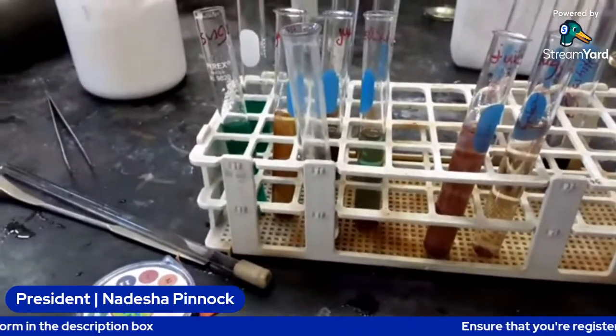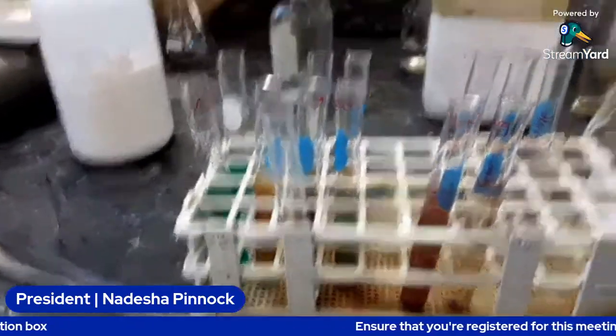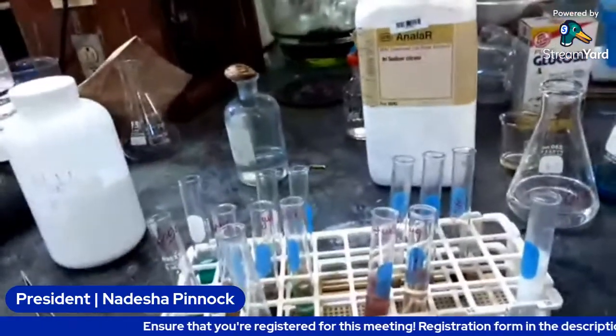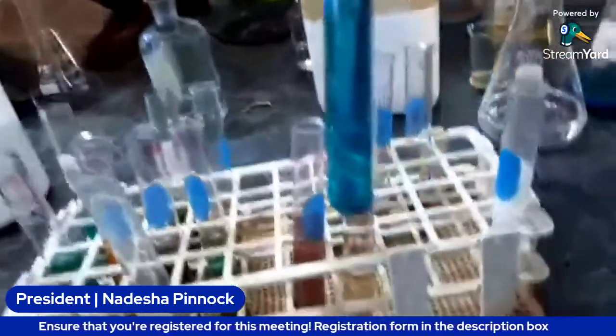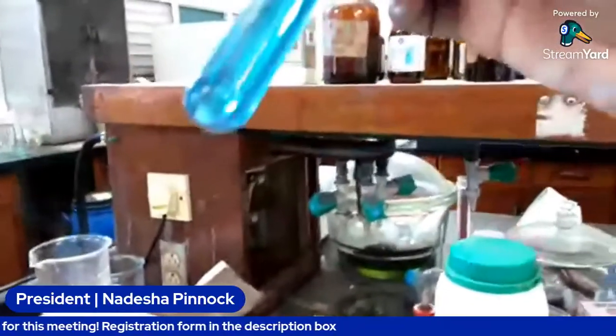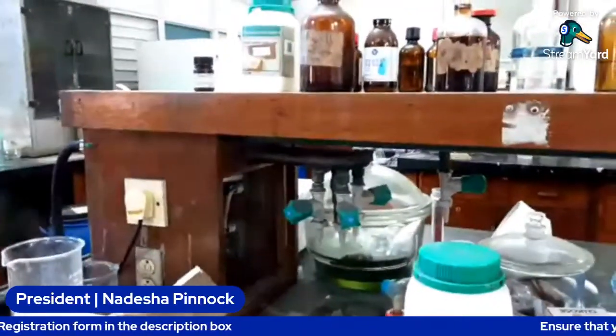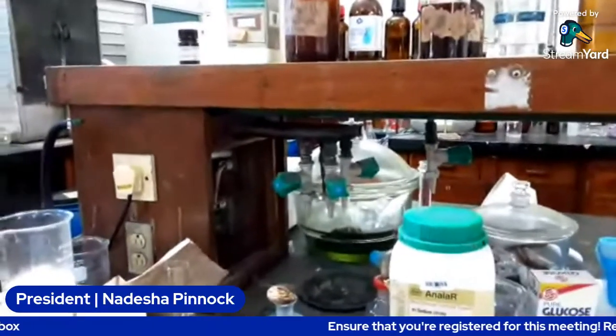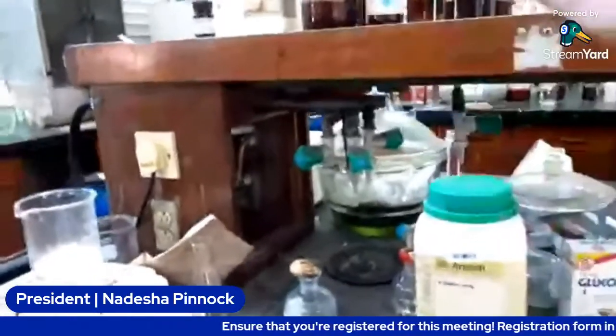So this is our sucrose. No, this is syrup. And this is how it looks. You probably can't see anything, probably because there's nothing there.